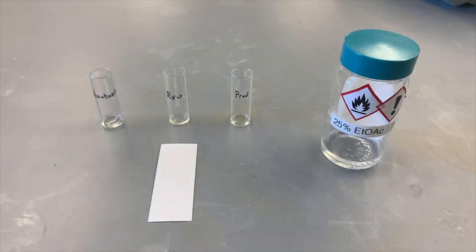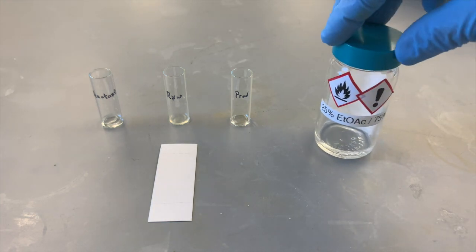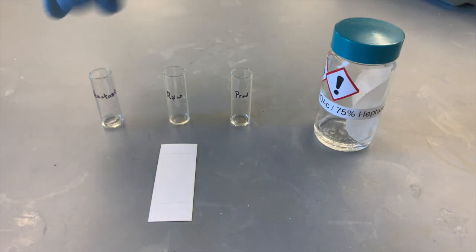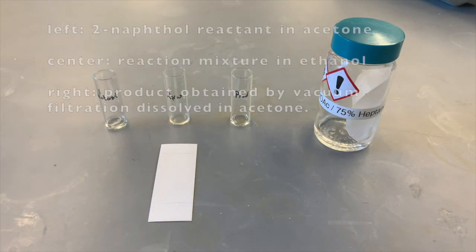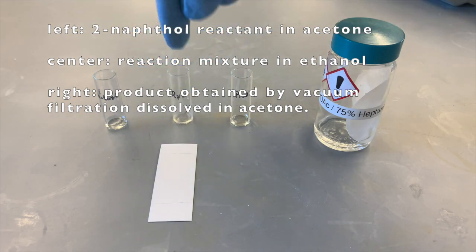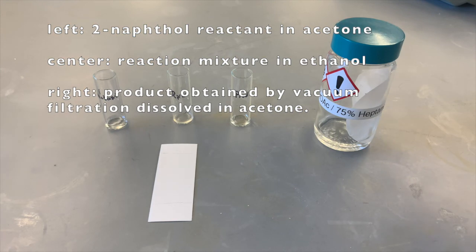Now we are going to analyze how well this reaction worked by using thin layer chromatography. Our solvent system is going to be 25% ethyl acetate and 75% heptane. On the left over here, I have a sample of our 2-naphthol, the reactant for the reaction. In the center, this is a few drops of reaction that we took out before we did the vacuum filtration.